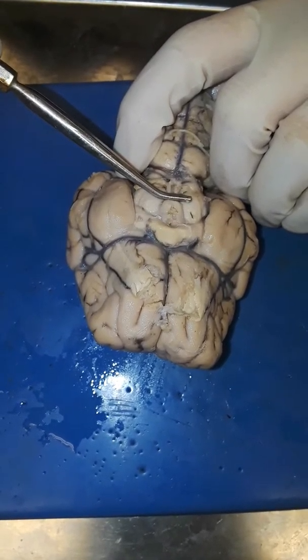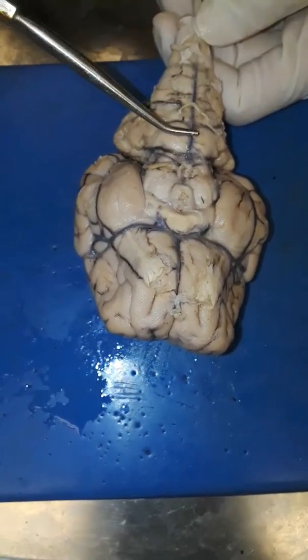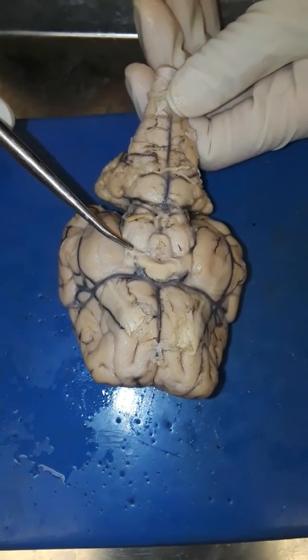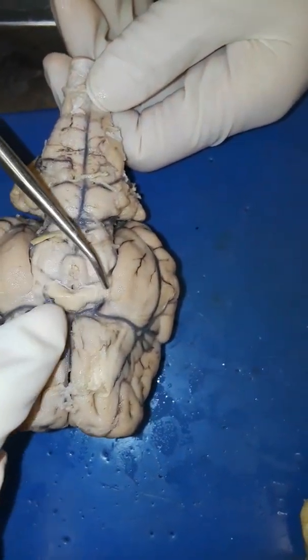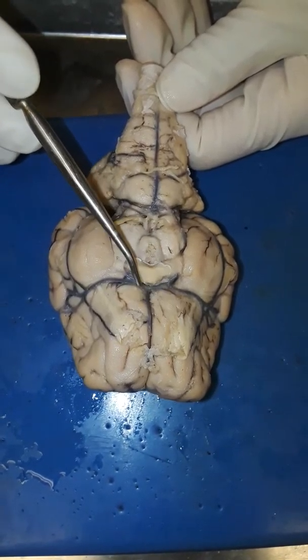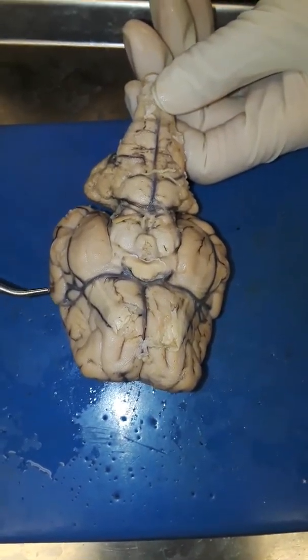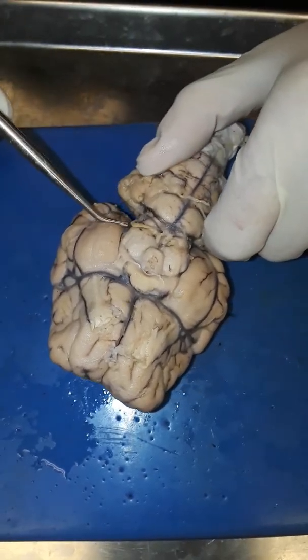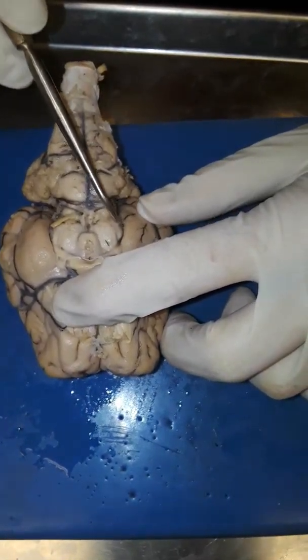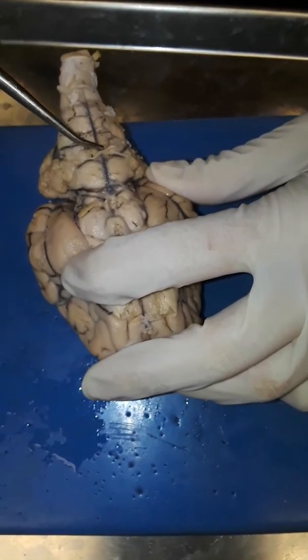The medulla oblongata — the part that makes alligators angry. The optic nerves are cut off on this one but they should be coming off of that, and then the optic chiasma is where those two connect there. The trigeminal nerve is missing — it's usually right here — and the abducens nerve.